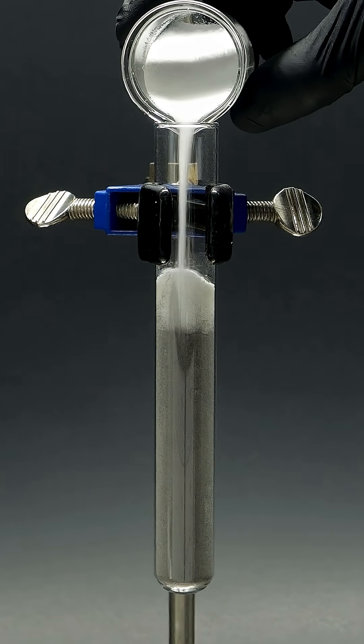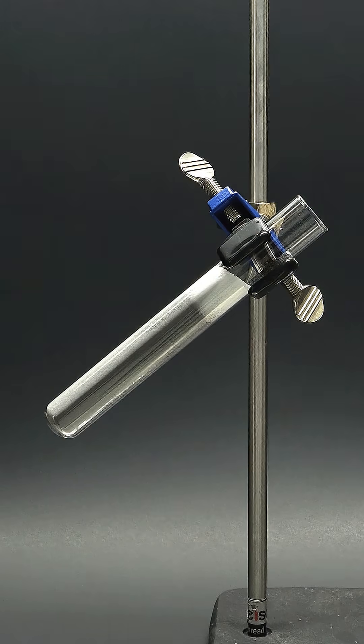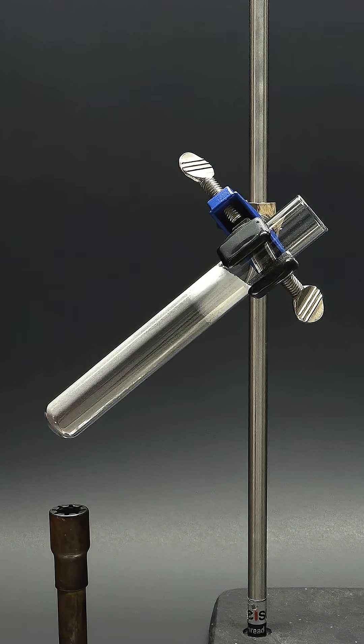I'll also cover the top with a bit of extra sand, tilt the whole thing on an angle, and add this Bunsen burner.